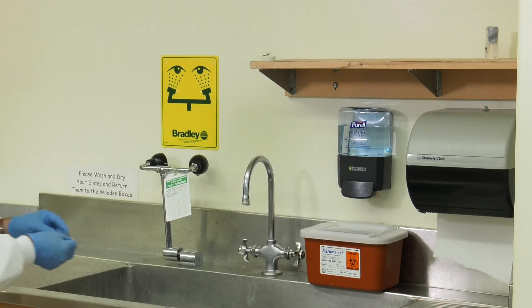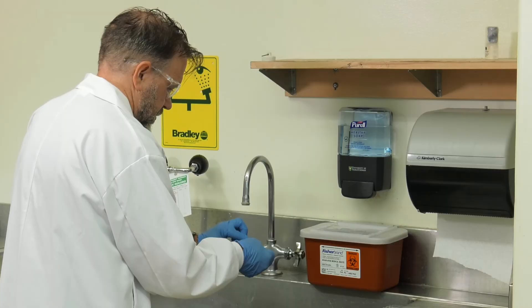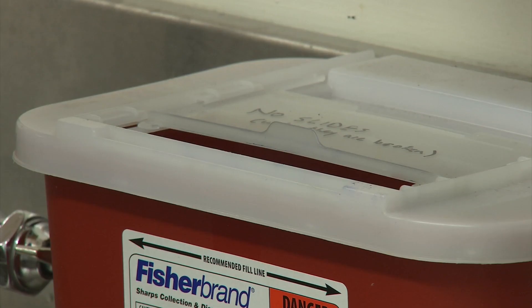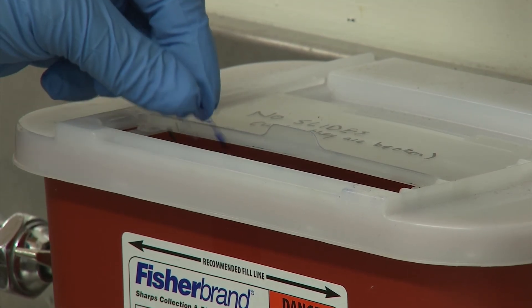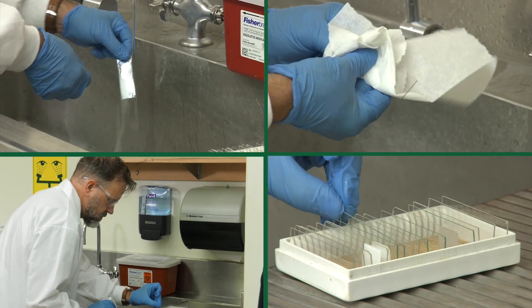Once finished with your preparation, take your slide to the sink. Carefully remove the cover slip and discard in the provided sharps disposal. Rinse and dry your slide and return it to the slide box. Let's get started.